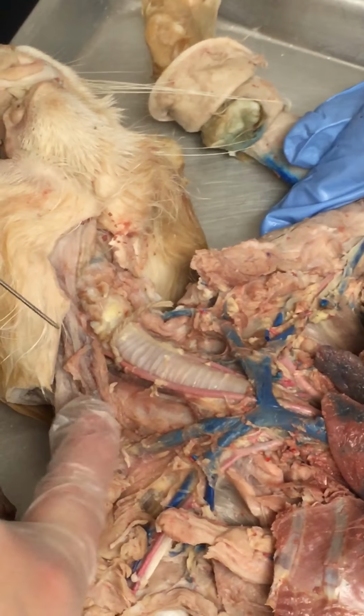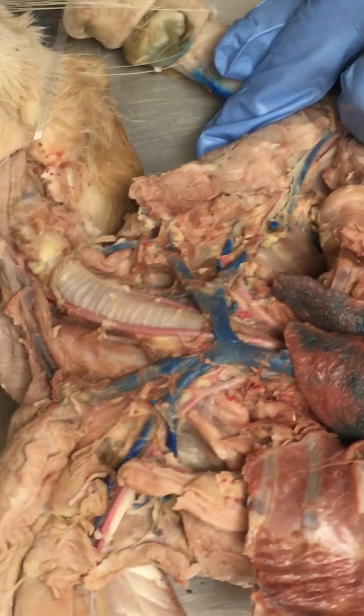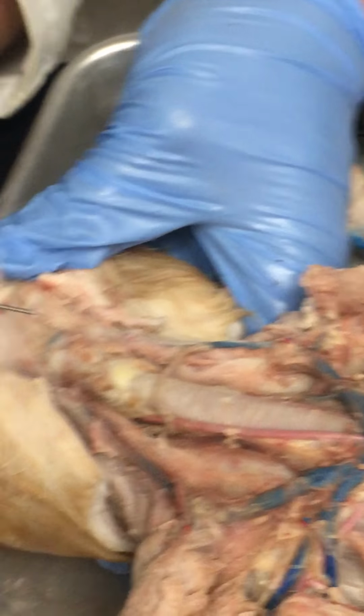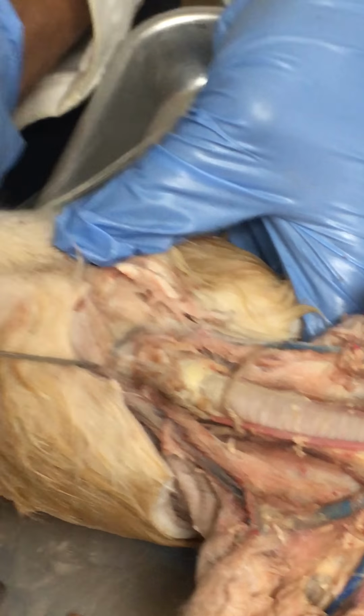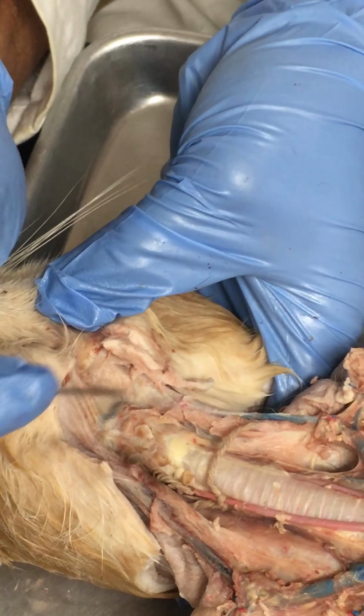So is this one part of the external? That's part of the external. Yep, it kind of hits right here and turns and goes on up. Up here, we've got the transverse. I haven't cleared this out very much, but you can see that dark line running across there. Exactly, on the transverse plane. So that is the transverse jugular right there.